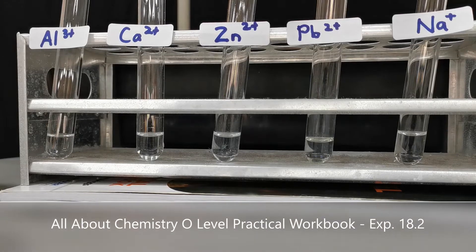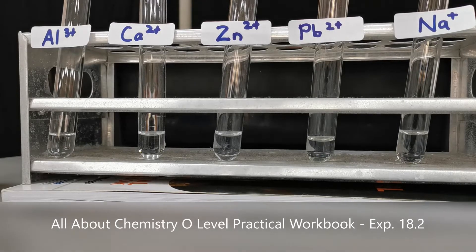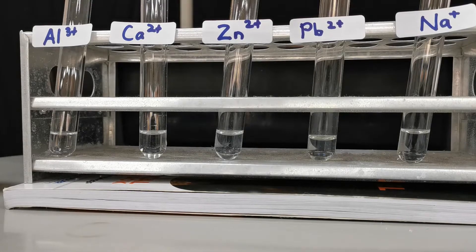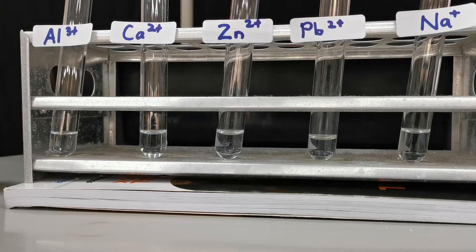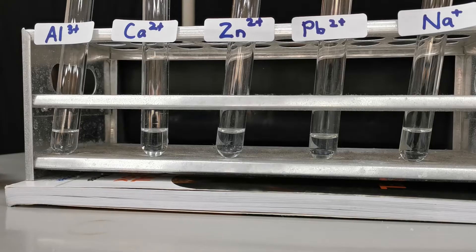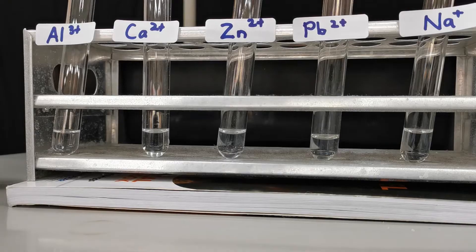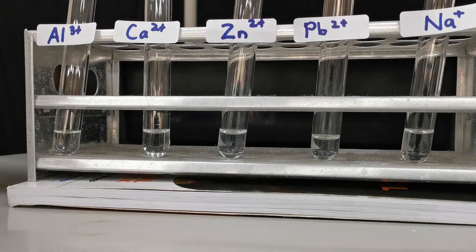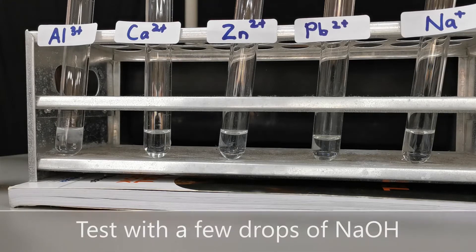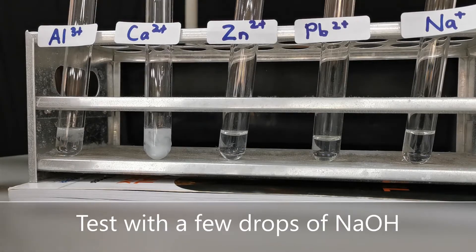In this experiment we're going to do experiment 18.2, testing for cations. There are several cations that we're going to test today: aluminum, calcium, zinc, lead, and sodium. Testing for cations requires the reaction with sodium hydroxide and ammonia. Let's see what happens when a few drops of sodium hydroxide are added into each of these solutions.